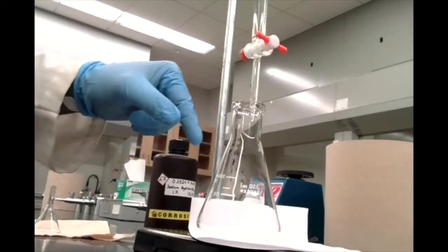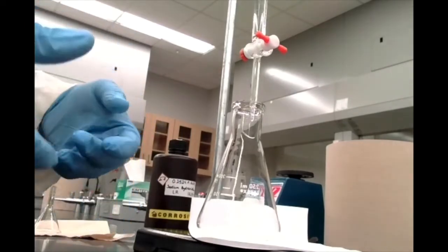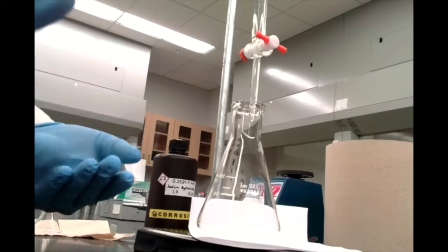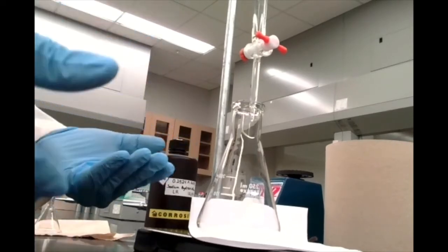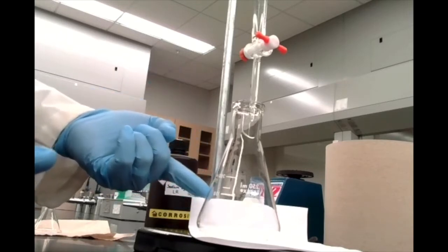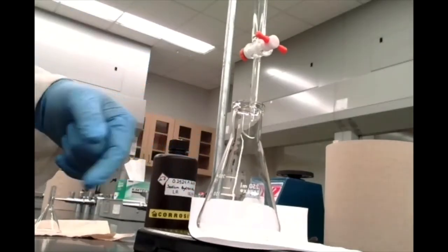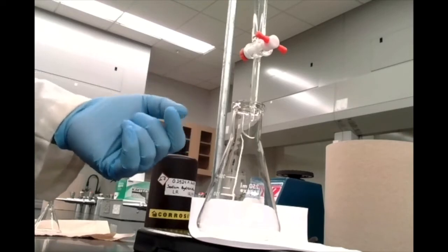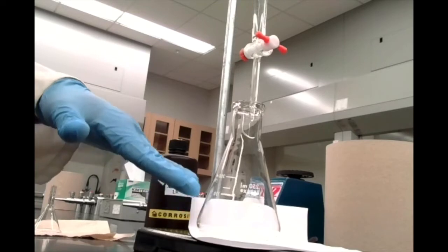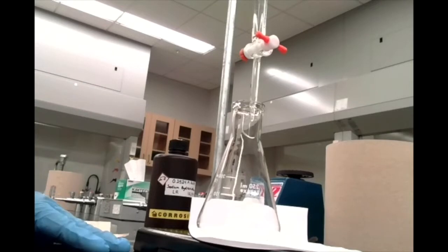However, when I swirl the flask, the surrounding vinegar that wasn't neutralized is coming in and using up that sodium hydroxide. So you could think of this in terms of a limiting reactant point of view. Right now, we have an excess of vinegar in there. That pink color is only going to stay when sodium hydroxide has used up all of our vinegar, and sodium hydroxide now is our excess. We want the vinegar to be our limiting reactant here. So we're going to keep on adding sodium hydroxide.